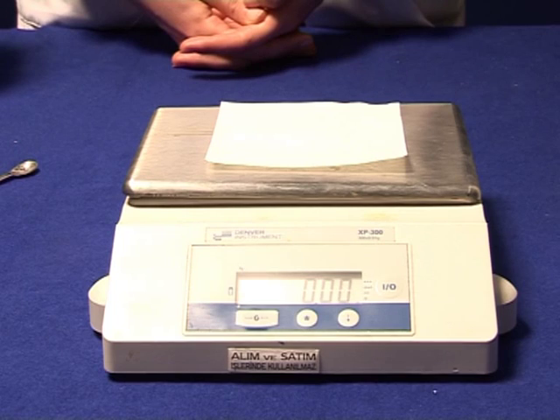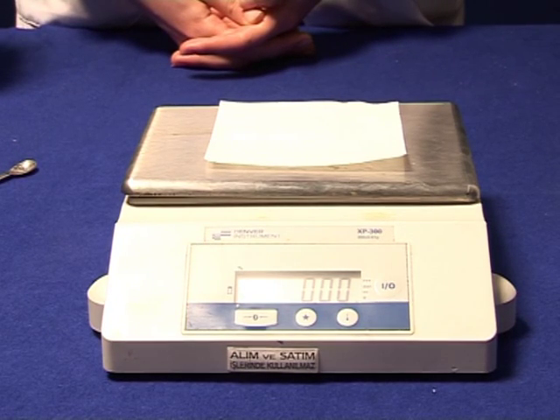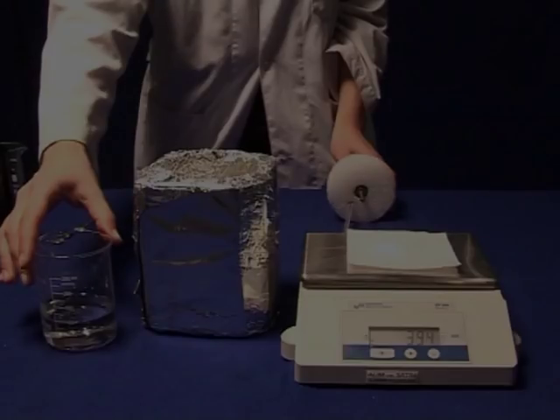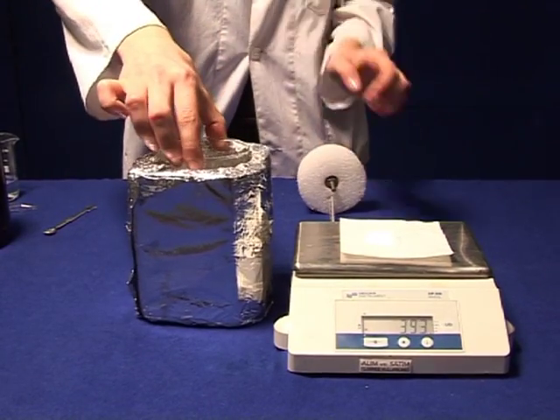Weigh and calculate the mass of ammonium chloride, ammonium nitrate, and ammonium sulfate that were formed in the first part of the experiment.